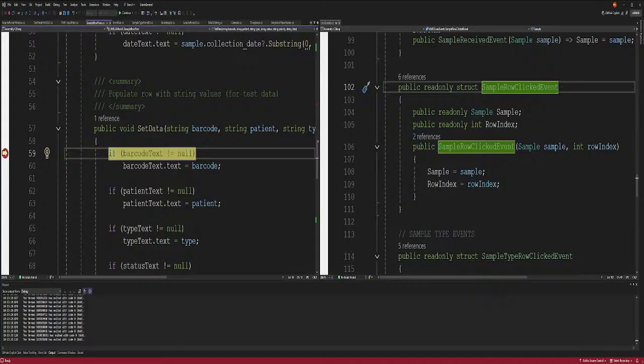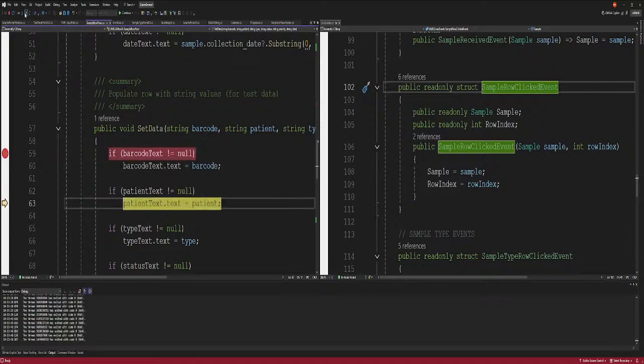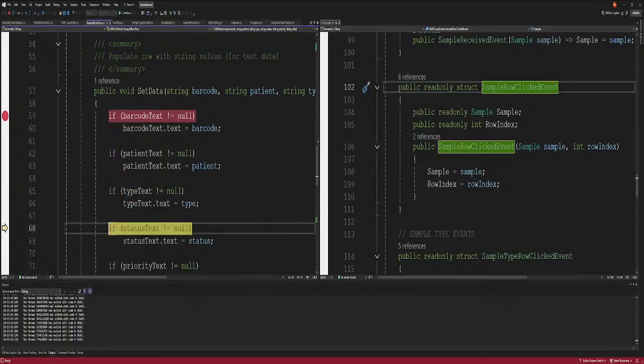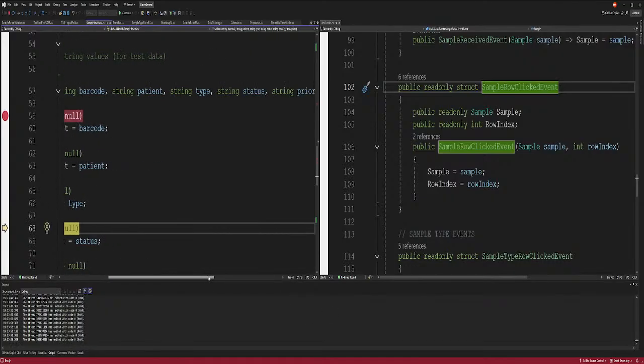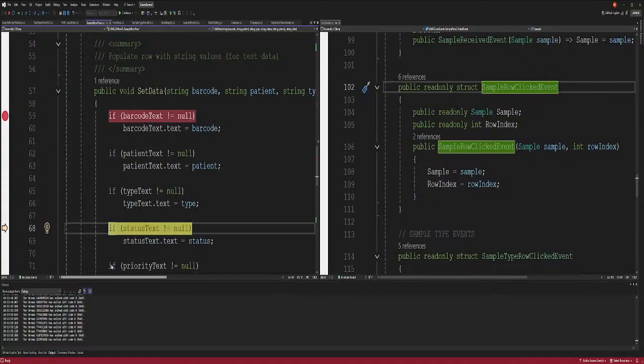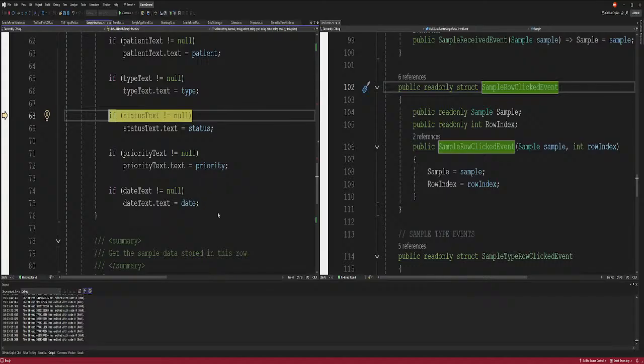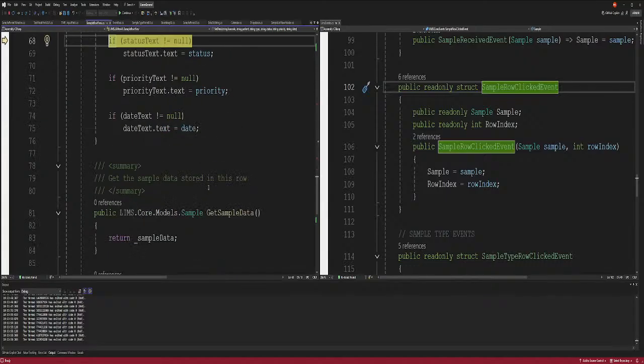Come on, don't get stuck on me. Oh, here it goes. I didn't get stuck. Okay, I've set the data, right? So we set the data. I'm sorry, folks. We set the data. All right, so make sure, right? Okay, this is status string, data string. Oh, it's setting data not in one, it's setting it in these. Okay, I get it.